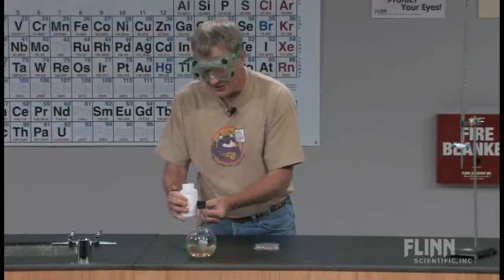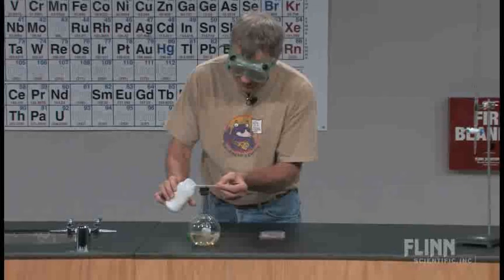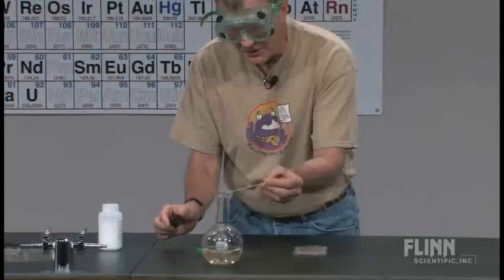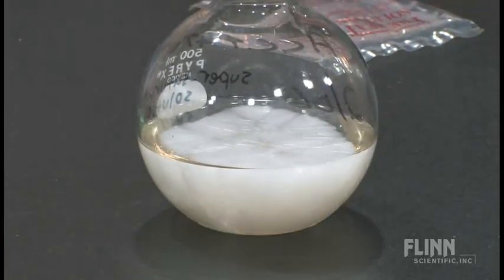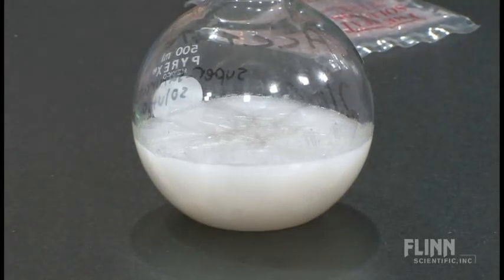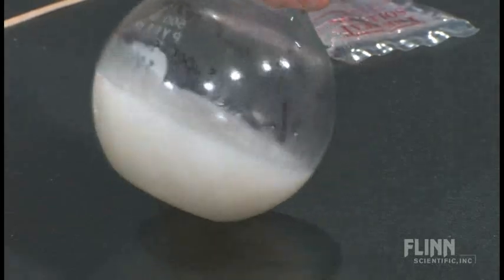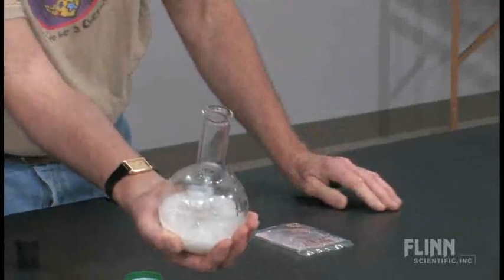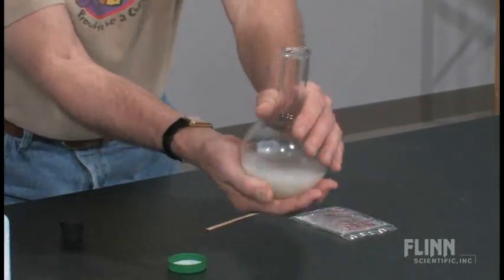The other thing that's interesting is that the reaction is pretty exothermic. I'm going to take a wood splint, get a few crystals of sodium acetate, pull the stopper out, and shake them in. You can see almost instantly all those sodium acetate ions in there are now getting together and solidifying — they found the crystal structure — and in a very short period of time it's done. I can't show this on camera, but the bottom of this flask is quite warm.